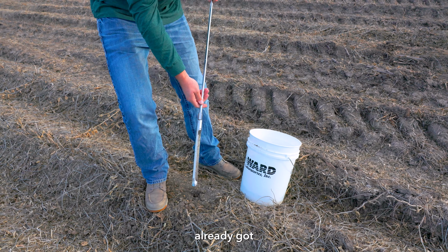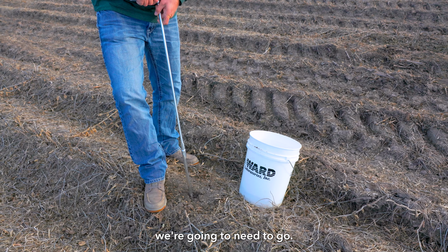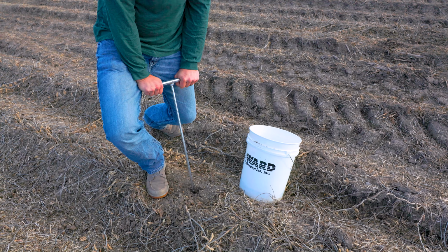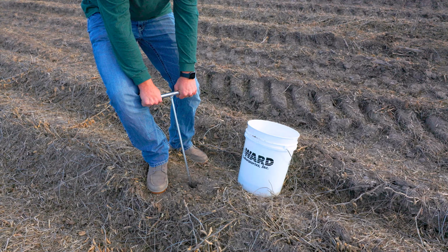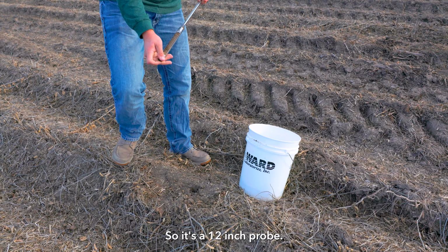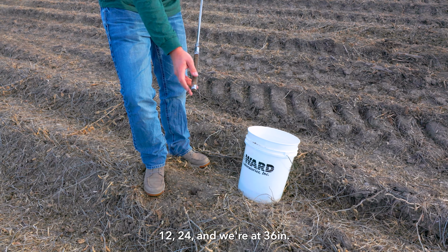And our probes already have our markings of every sample here, so we know how deep we're going to need to go. It's a 12-inch probe, so now that we've gone 12, 24, and we're at 36 inches.